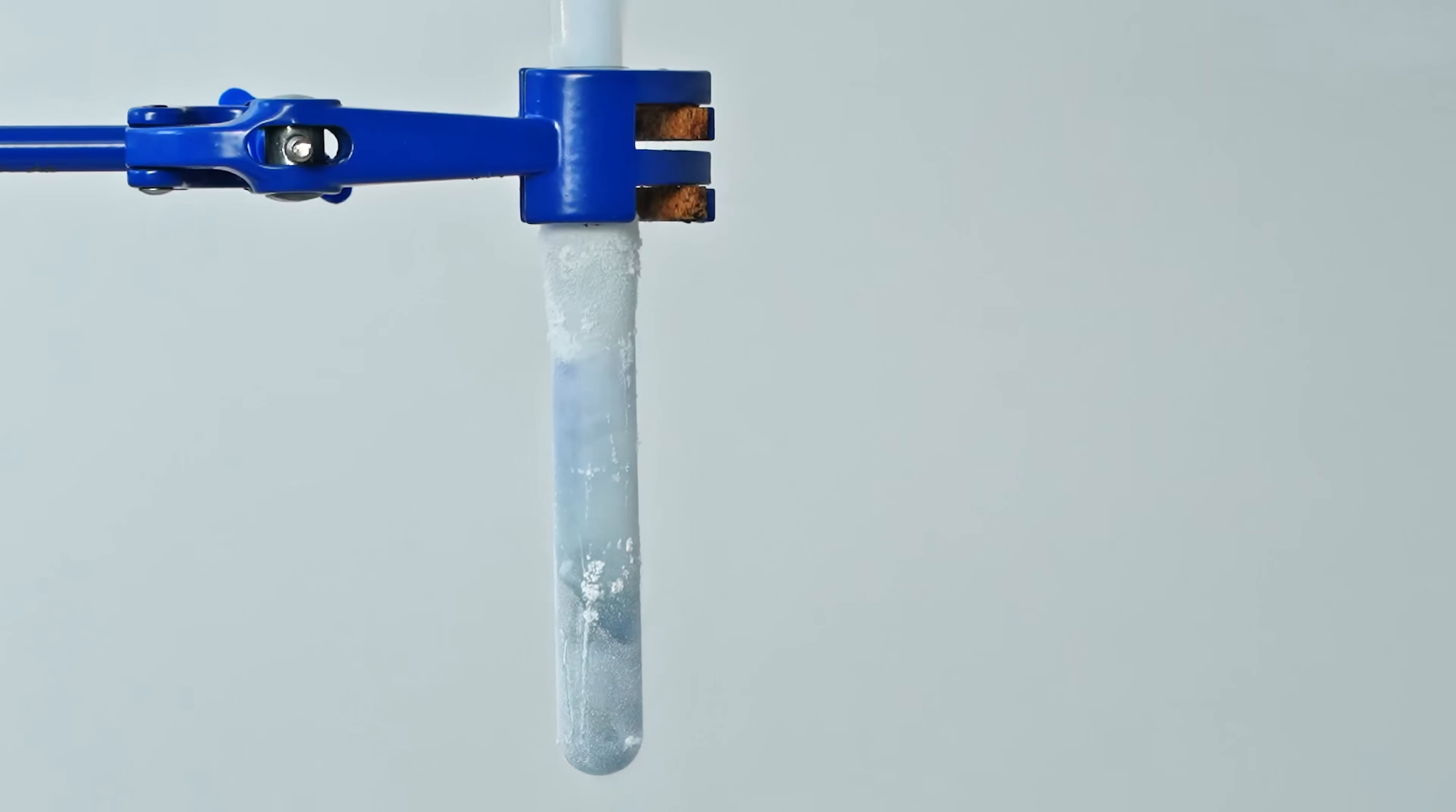Interestingly, the color in the test tube changed from the blue characteristic of ozonated oxygen to the blue characteristic of nitrogen trioxide.